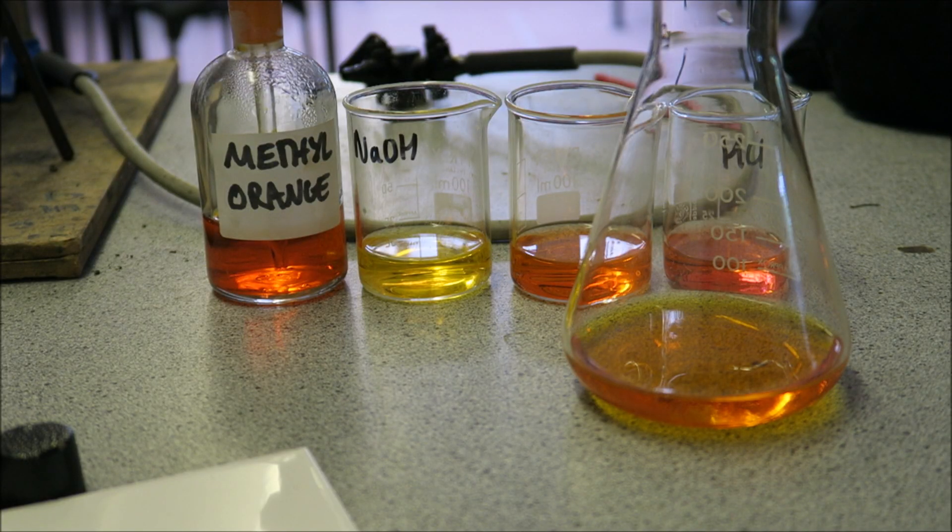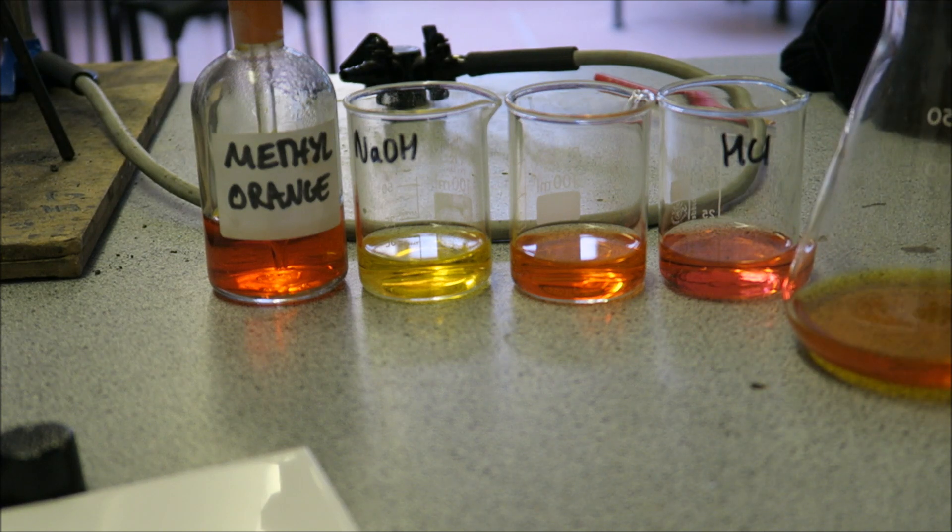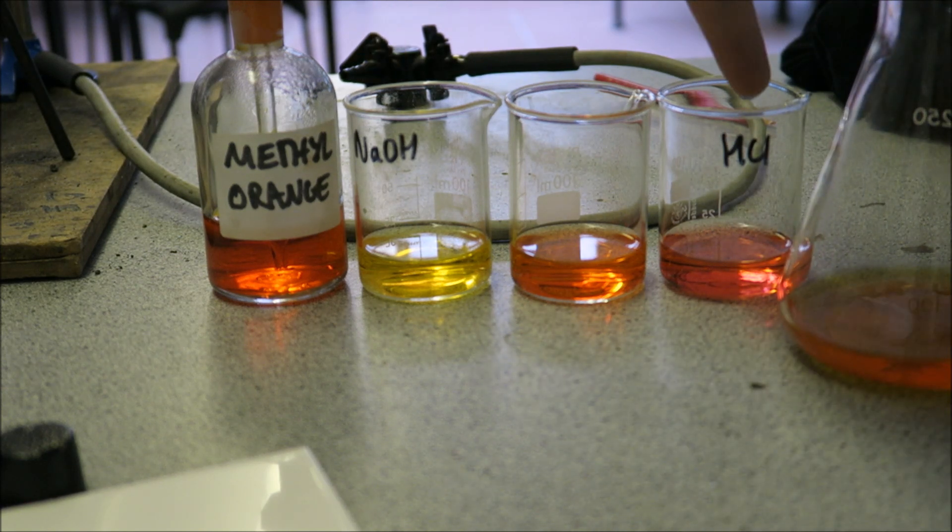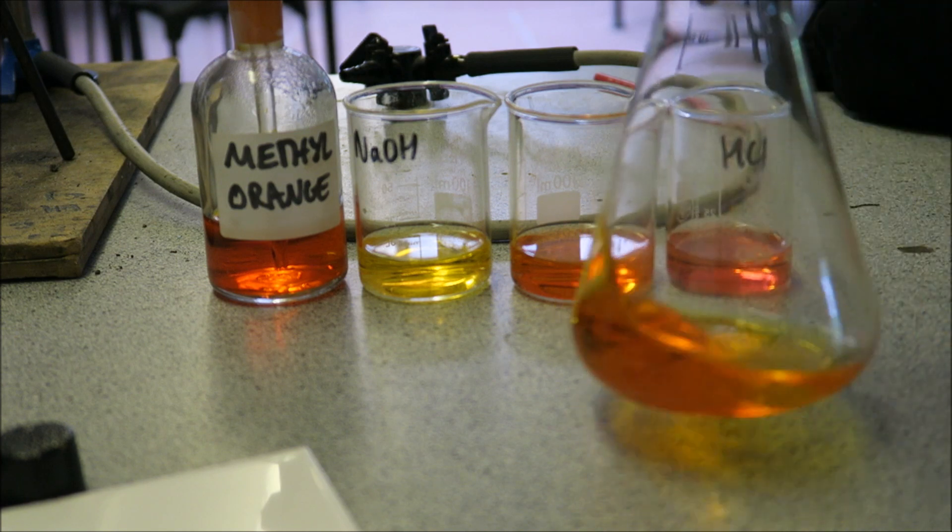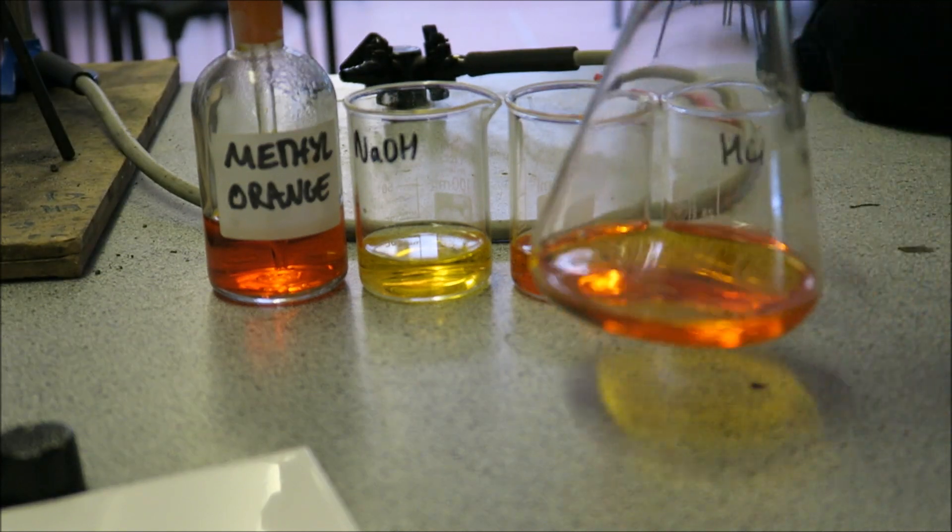I'll just do this quickly and show you what the endpoint looks like. So here we go, we've got to the endpoint. It's always worth, if you are not sure what the endpoint is supposed to look like, having alkali, acid, and endpoint set up over here. Then you can just compare it and see which one you're at.